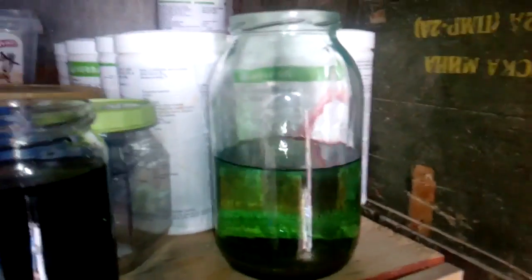After one morning, after 24 hours, we got our gold. Better look in the morning in the sun, see that, all that gold. It's pretty clean and it's heavy, so now we're gonna filter that and go to melt.